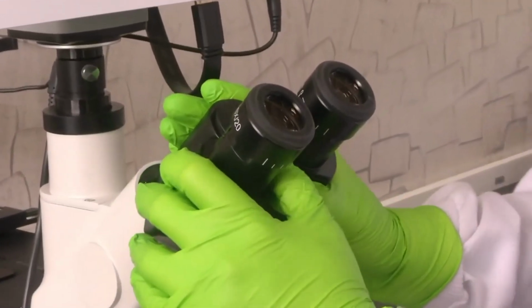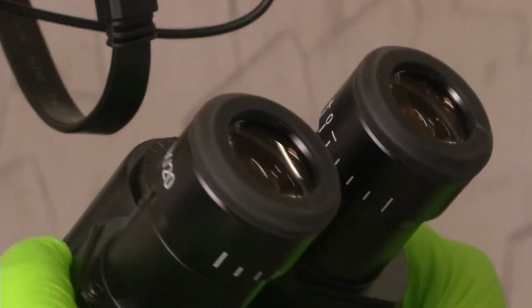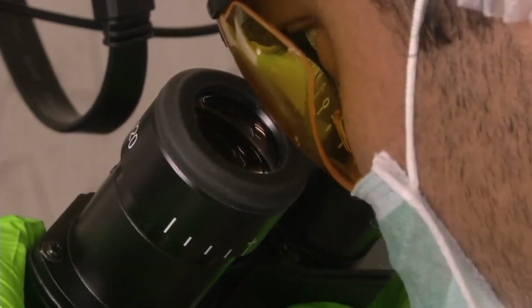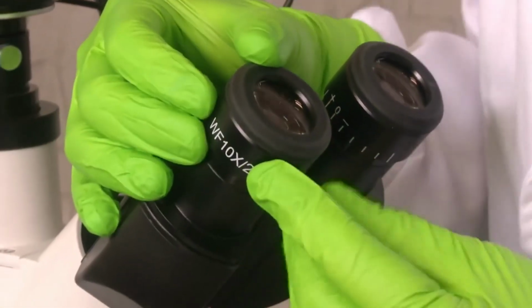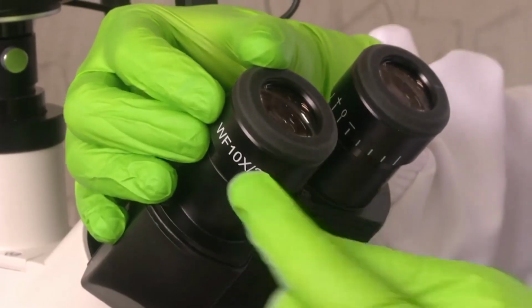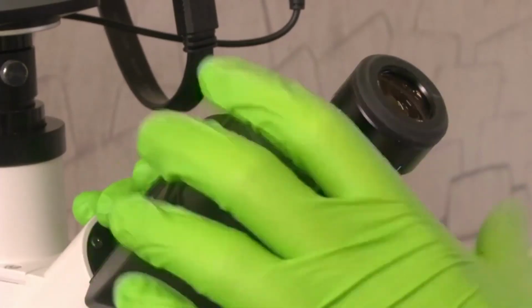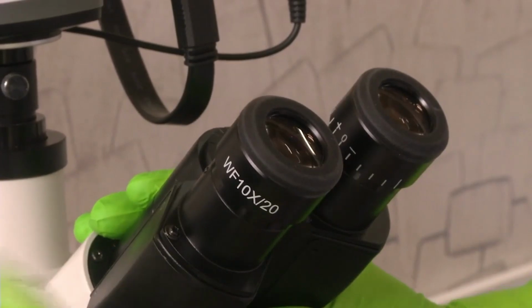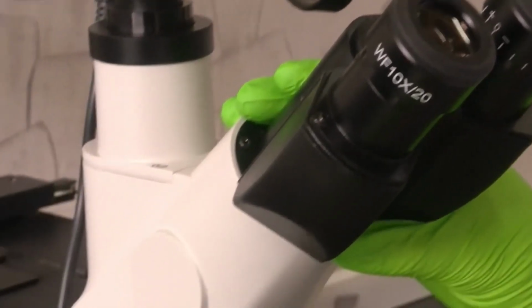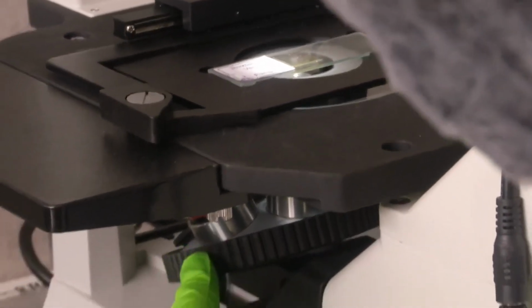This is the eyepiece which is present in almost all microscopes. You can adjust it to your eye size and adjust the eyepiece accordingly like this, and then see through the eyepiece. The eyepiece by itself has a 10x magnification. If you see, it is by default giving you 10x magnification. So, the eyepiece is a common component of any microscope system. Now, let us look at the core part of the inverted microscope, which is the turret objective array. So, let us see, we will focus there.